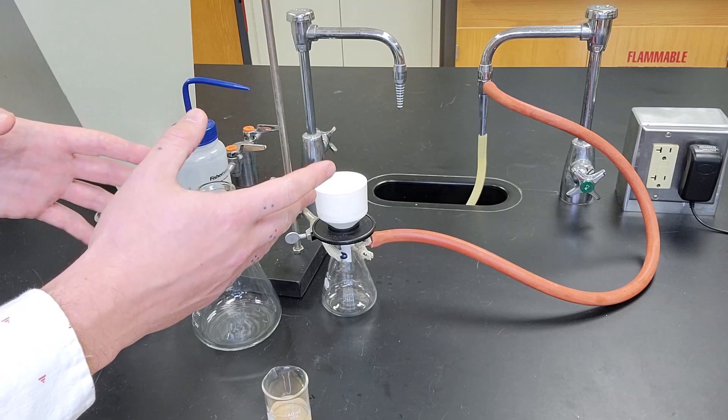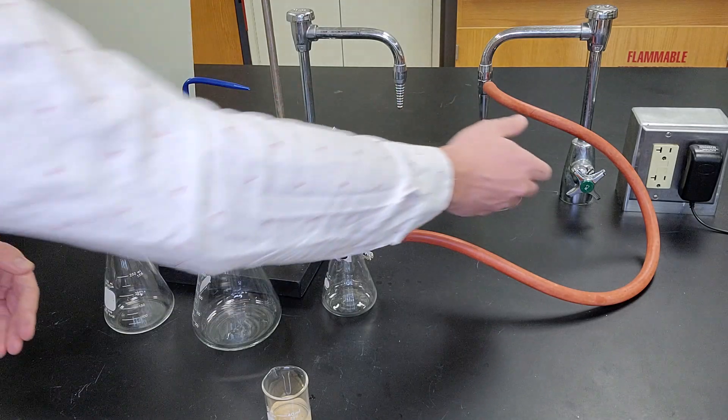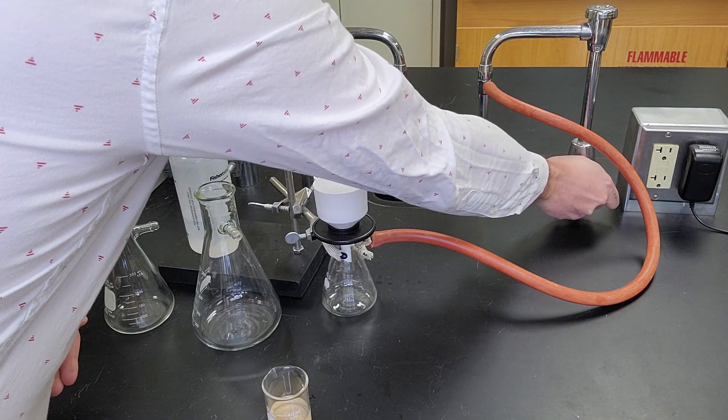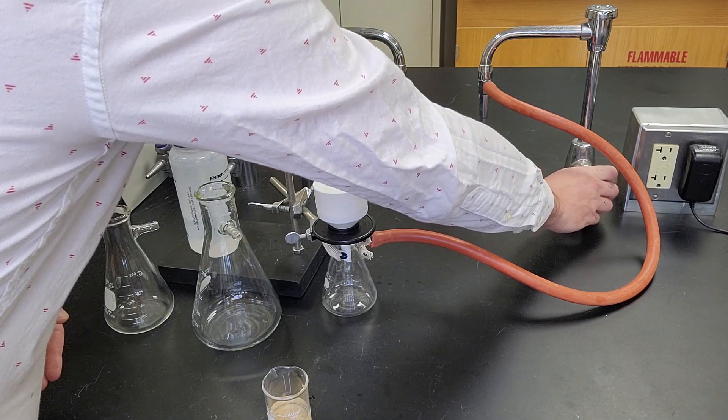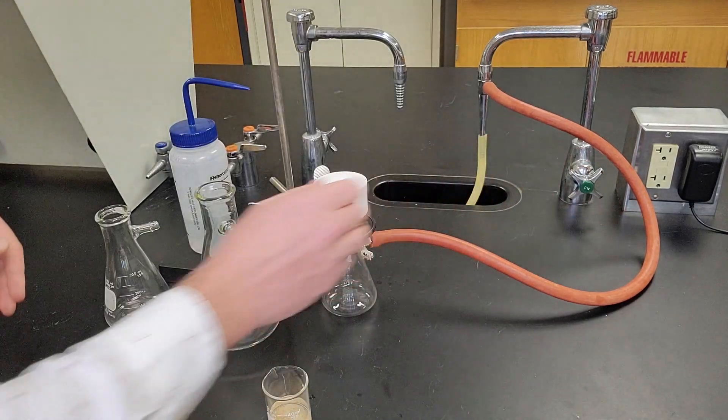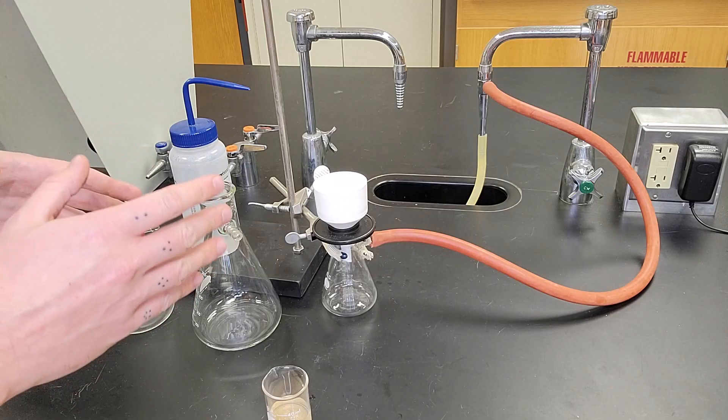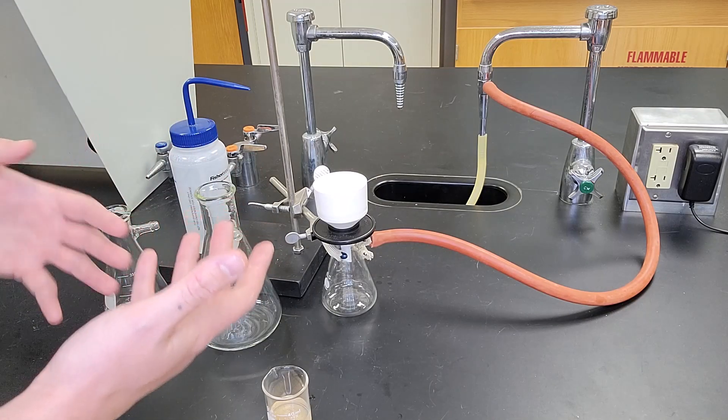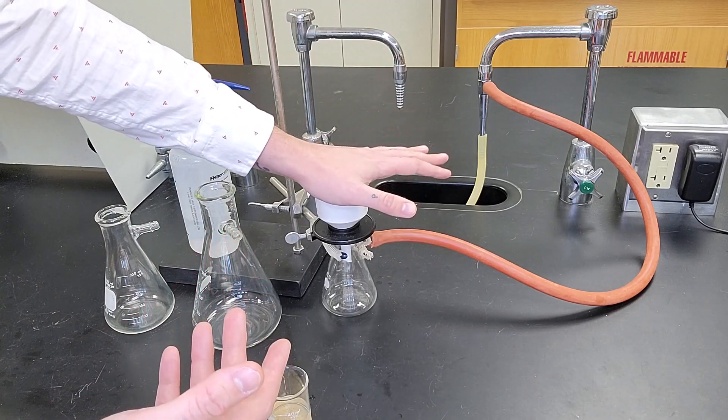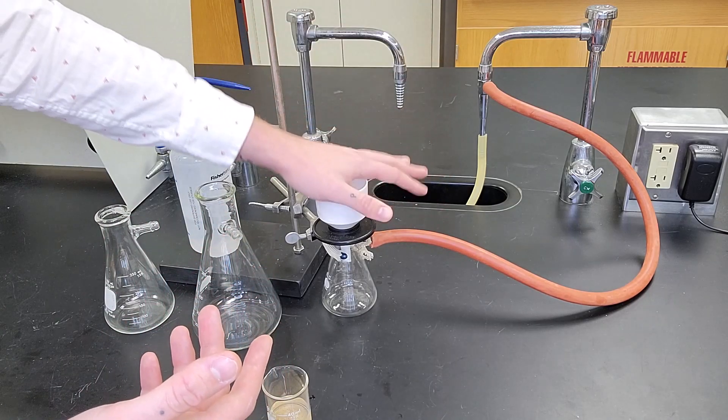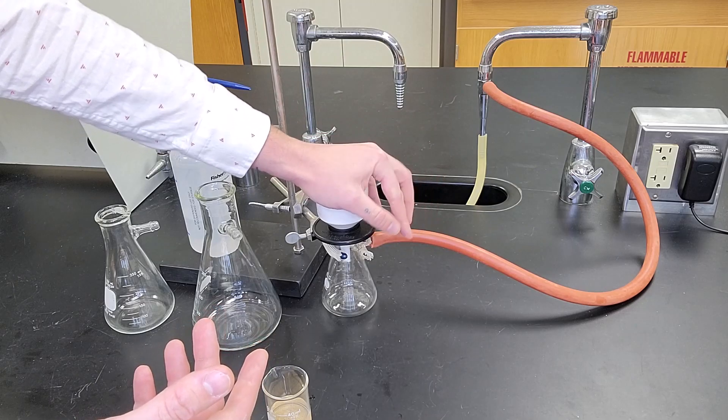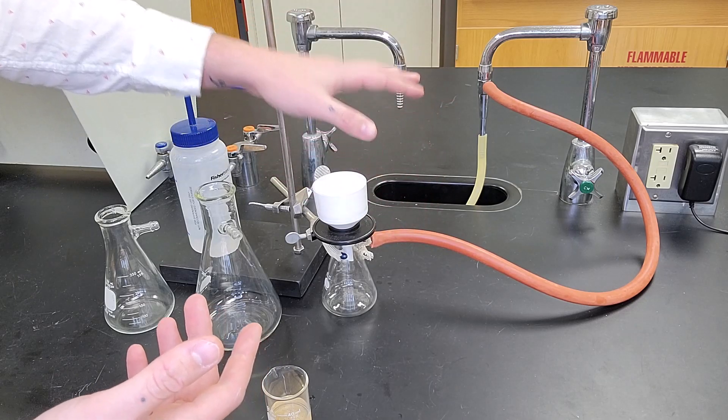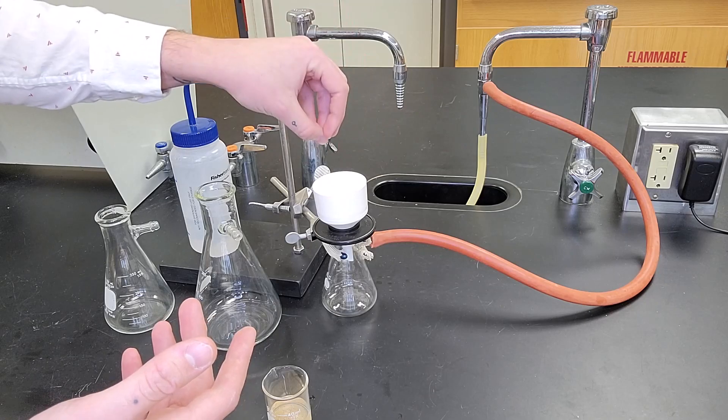So we're going to turn on the water now and do a vacuum filtration. One of the nice things about a vacuum filtration is you should be able to feel when the vacuum is going. If I put my hand over and press down, I can feel a strong vacuum—in fact, it sucks my palm into the funnel almost instantly.